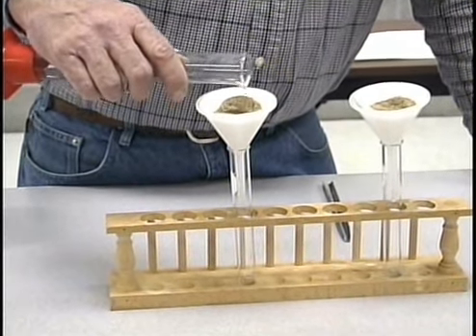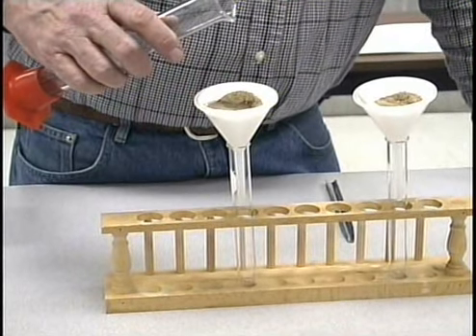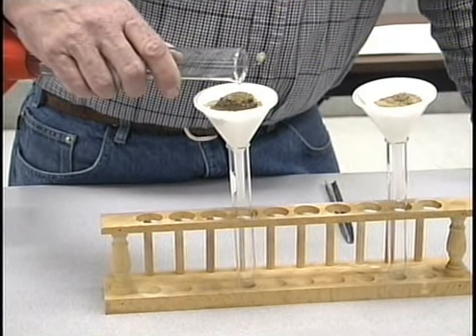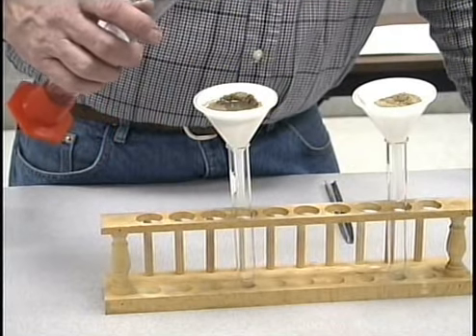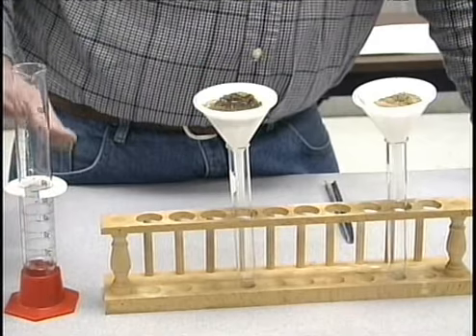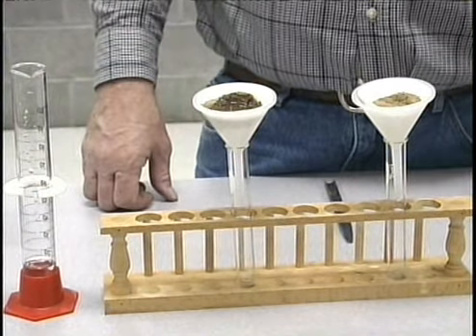It's going to take a period of time for this water to wet the soil and to pass through it. I've got to be careful not to overfill or run too fast because I don't want any of this material to go over the edge of the filter paper. It will take soil particles down into my leachate if that happens. So I've added some distilled water to that. It's going to take a period of time to start to work through the soil and through the filter paper.